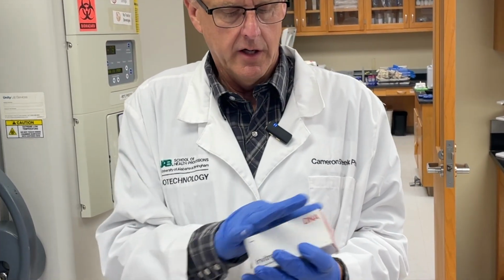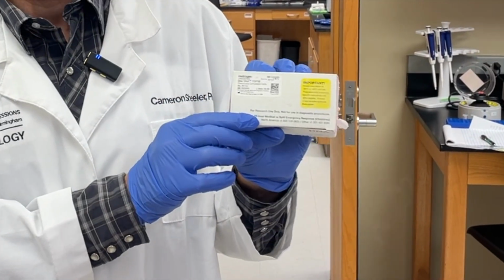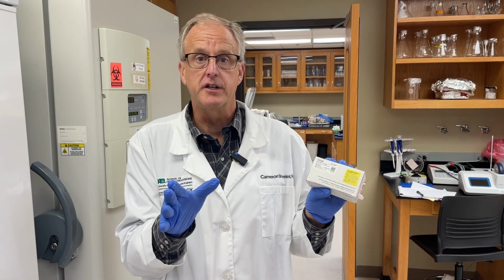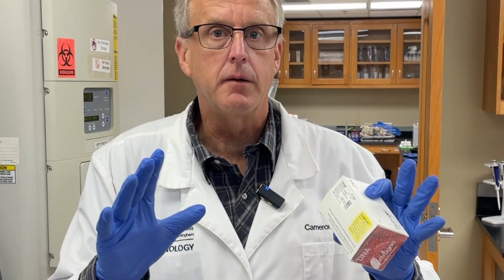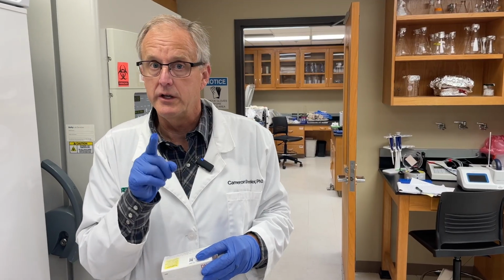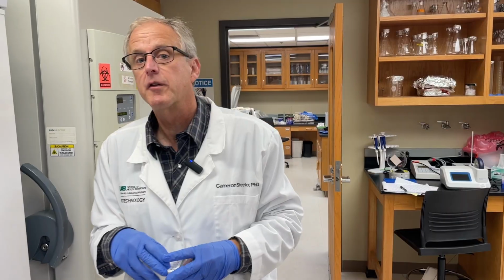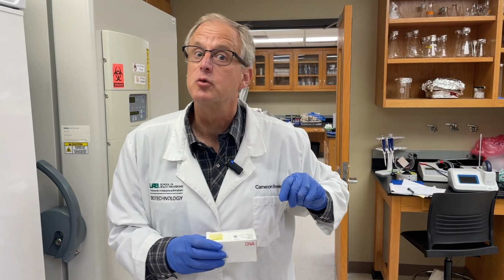The E. coli that we're using is from Invitrogen. It's called One Shot Top 10. These are competent bacterial cells that are primed and ready to take up the plasmid. So I already have some thawing out. Igor has already done this. I take the vial out and put it on ice, let it thaw out for 30 minutes. So our first player, E. coli, is waiting for us.